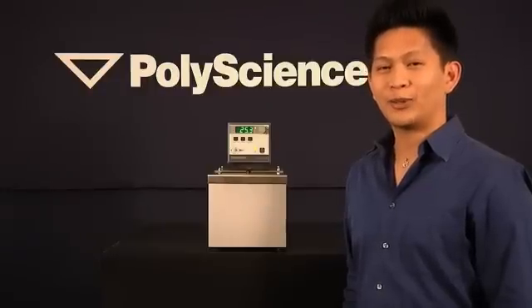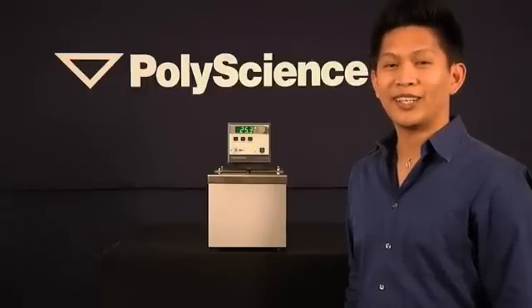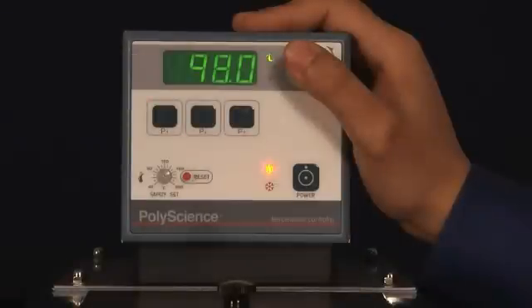This feature enables users to lockout control to their units while keeping the unit running at its current settings. To activate this feature, simply press and hold the select set knob until the screen reads LLO. This would take approximately 10 seconds.